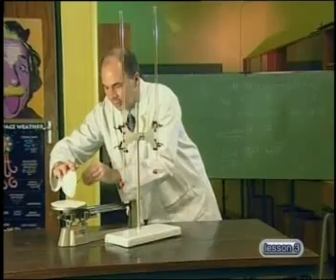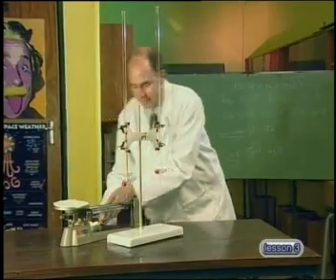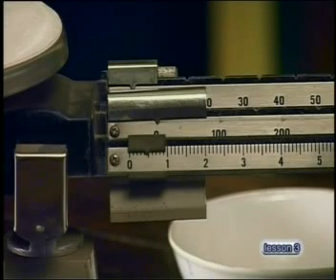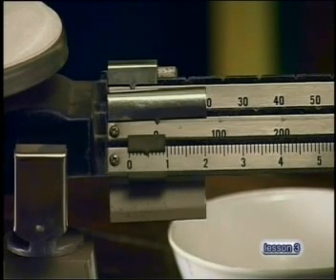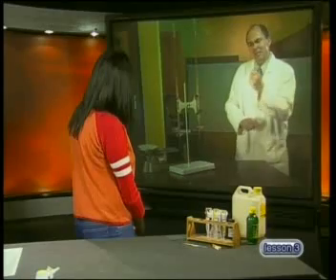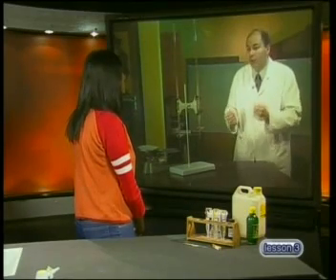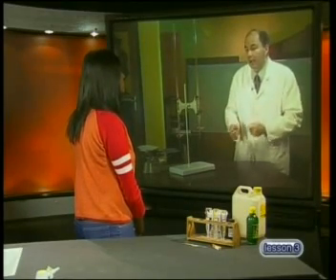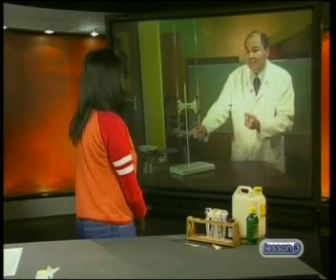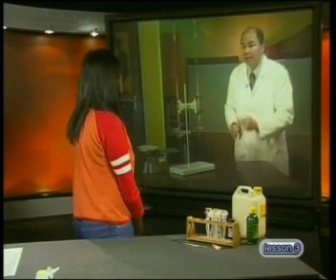I'm going to scrape them out and use the triple beam balance to find their mass. Now let's check the reading — it's just less than 0.5 grams, which is less than what we expected, but that's because of experimental error. I might not have got all the crystals and this scale might not be measuring accurately enough.